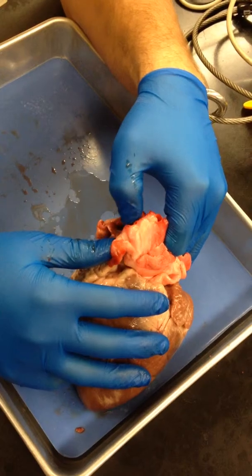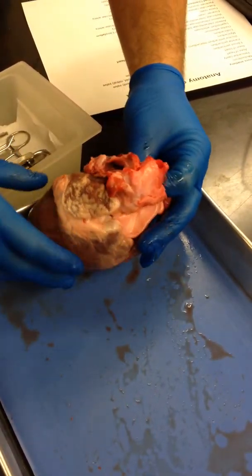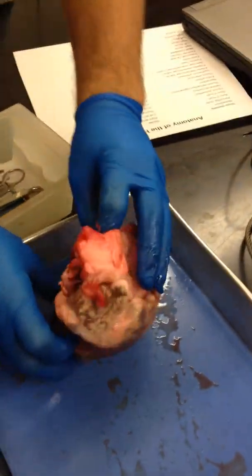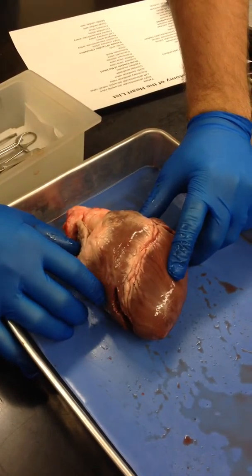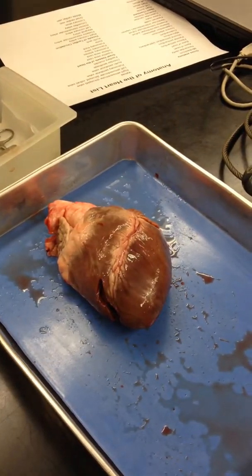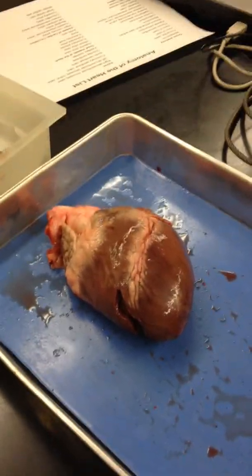Wait, is that right there? Okay, here it is right there. All right, so come test us — side to side. We need to know that this is the right side and that this is the left side. How do you demonstrate? Just kind of by feeling that. Did you feel it? Soft. How do you feel it? Are you going to feel it? Maybe later.